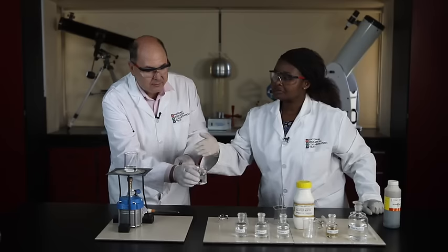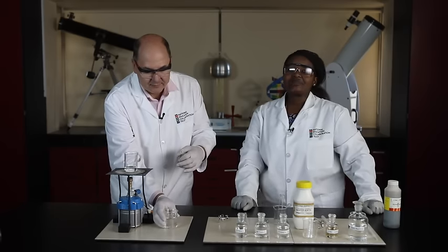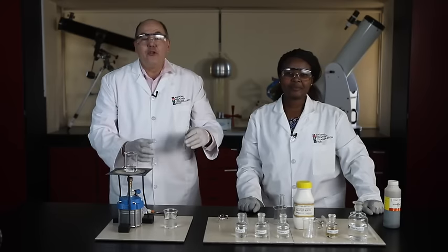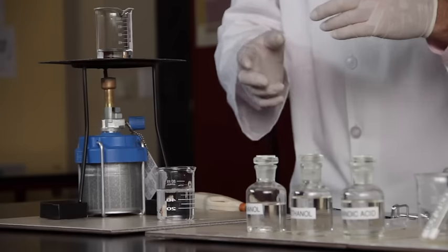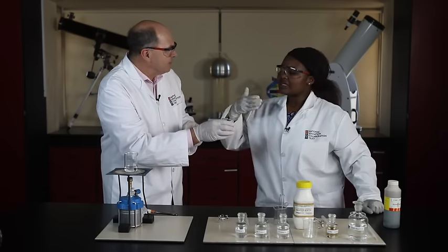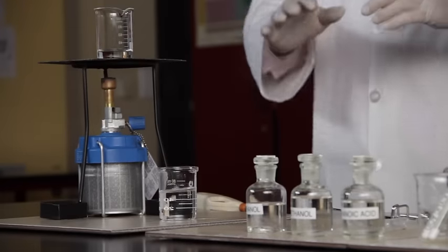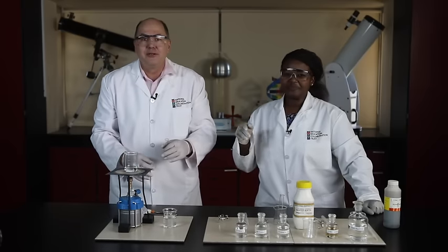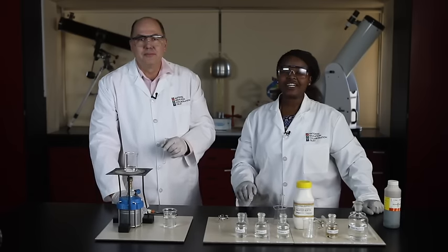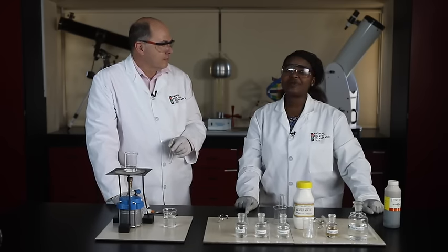Have a waft at this mixture. It doesn't smell like vinegar, does it? Not at all. Remember that in any laboratory, chemicals are smelled by wafting the odor towards the nose with a hand like this. Beautiful. Now you never put your nose over the reaction mixture when you smell anything. This particular mixture, I can't quite place it, but it certainly doesn't smell of vinegar. Not at all. What do you think it smells like? I think it smells like enamel paint. Yeah, paint thinners. That's it. Oh no, it's not very pleasant. I think we should find another more pleasant smelling ester. It's a very distinctive smell. But I'm sure there are other esters that have a much better smell. Before that, learners, you should record the fragrance of this ester formed by the reaction of ethanol and ethanoic acid. Later on, you can complete the other questions on the worksheet. But meanwhile, we are moving on to prepare another ester.